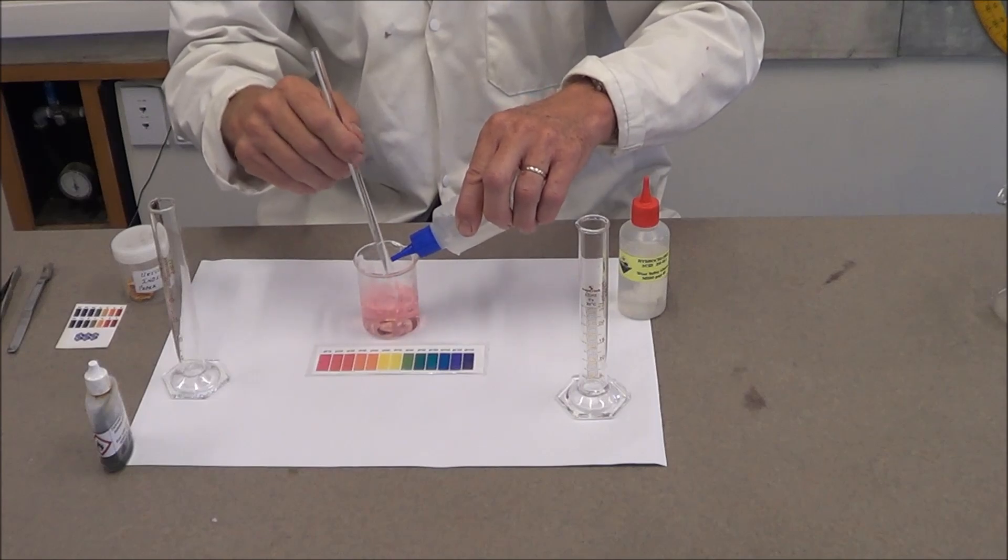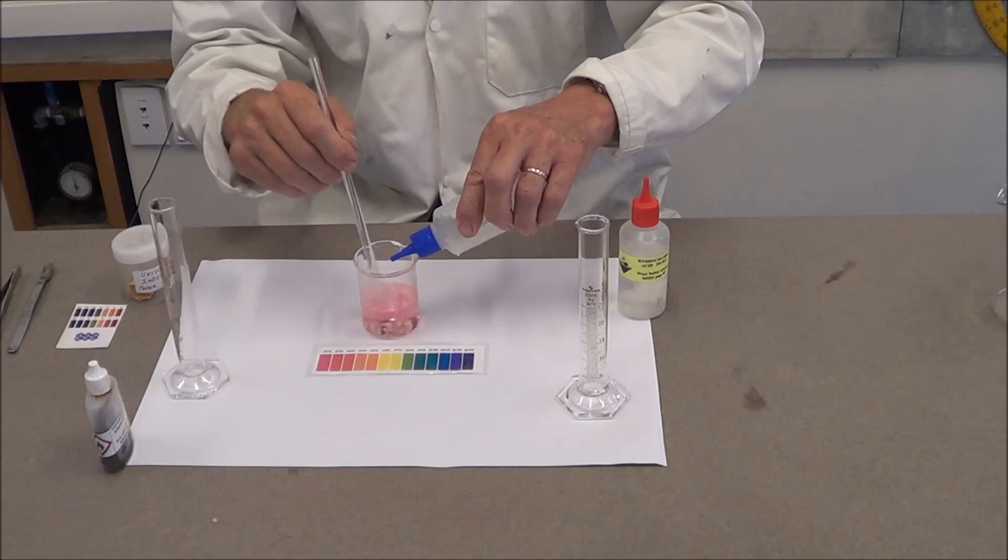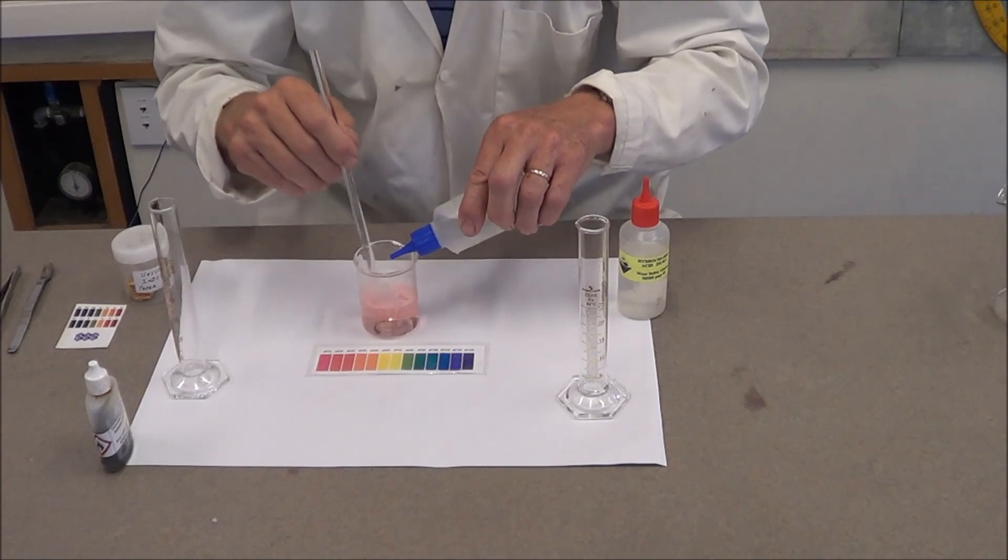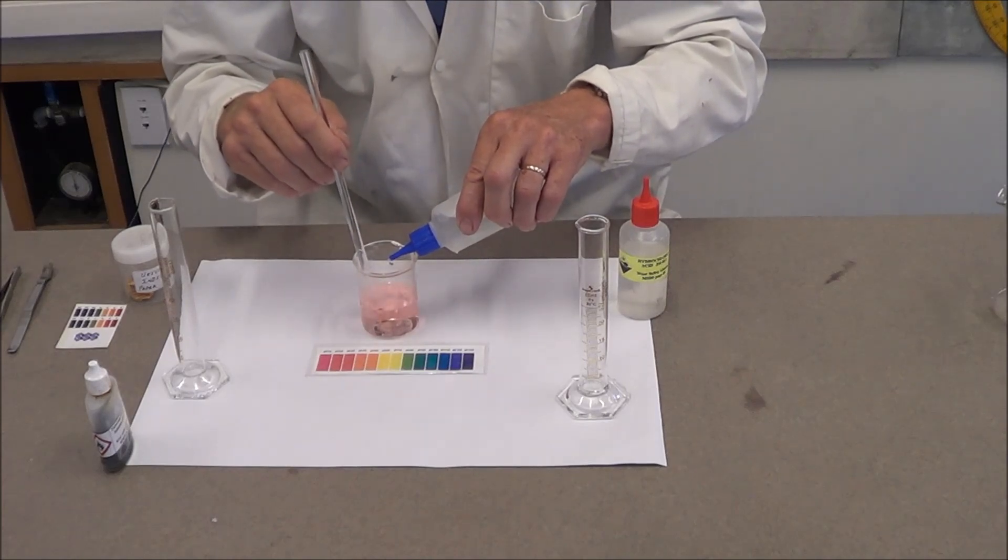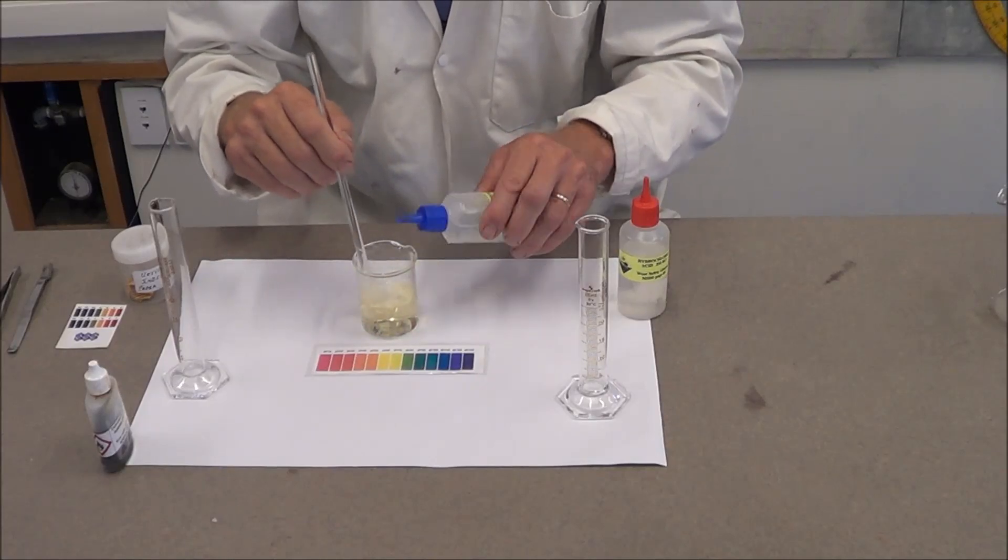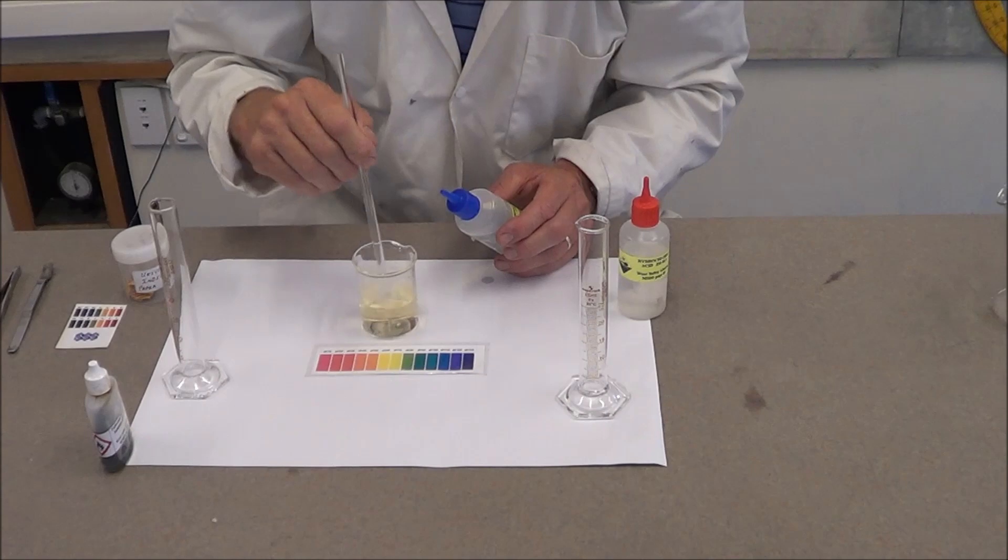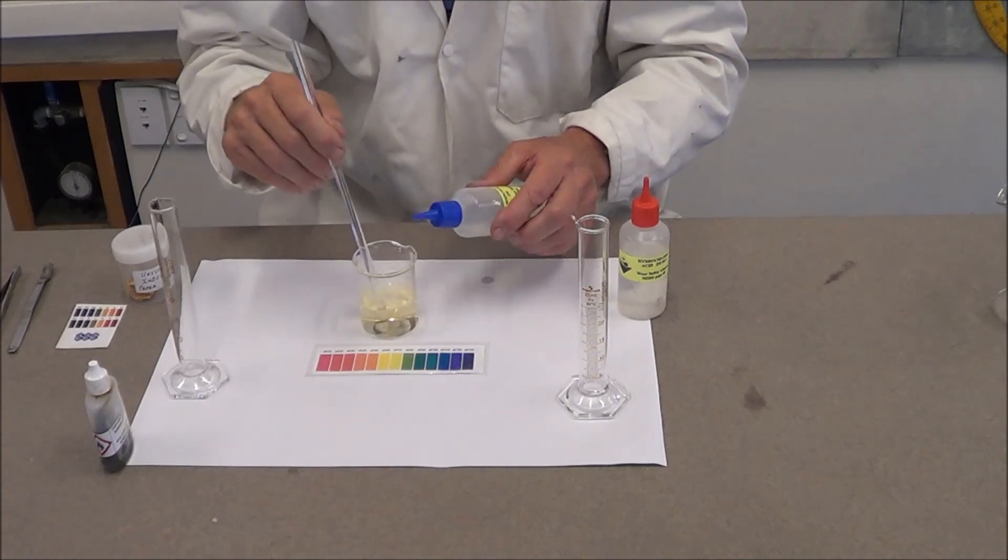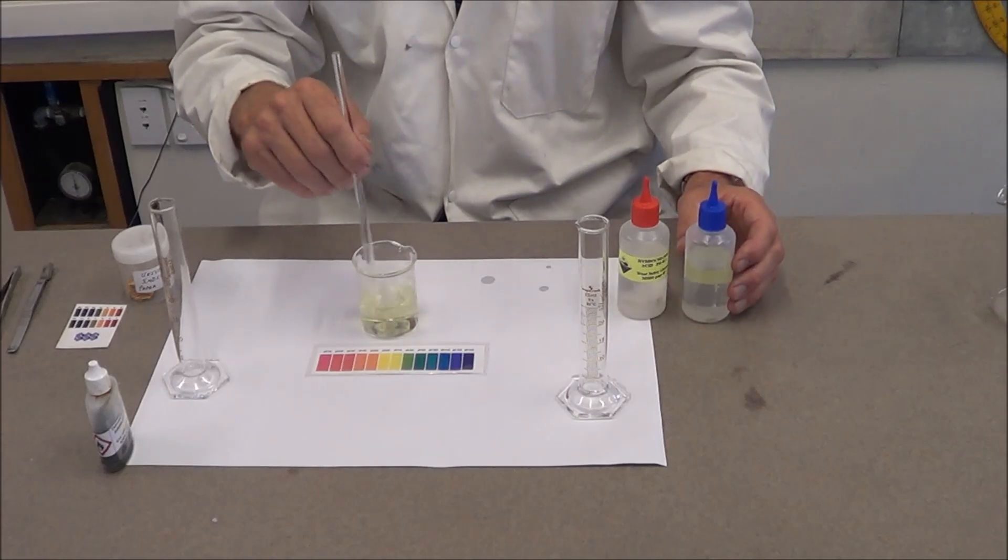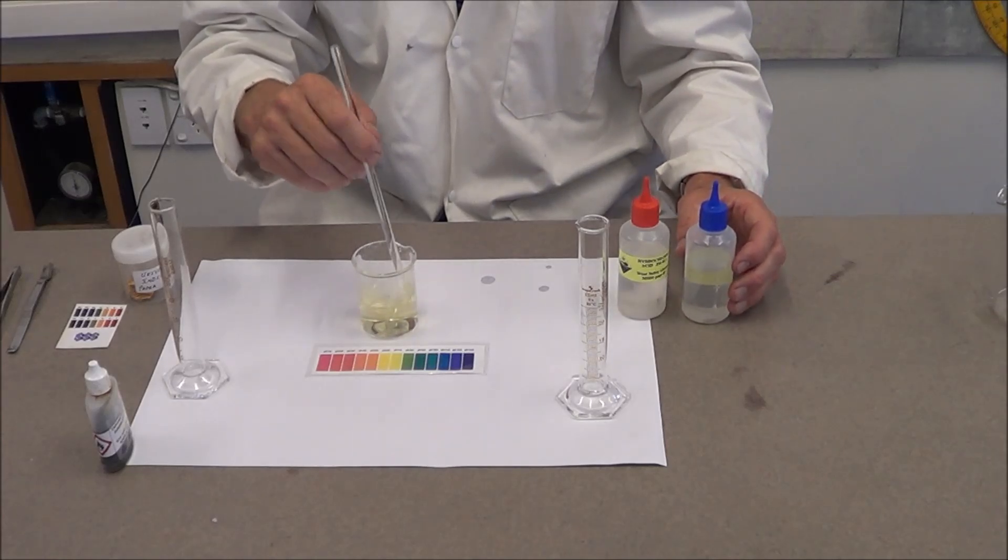Notice that the changes are occurring now. We have to slow right down, as one drop can in fact make quite a difference. We'll just add another half a drop to that. There we go.